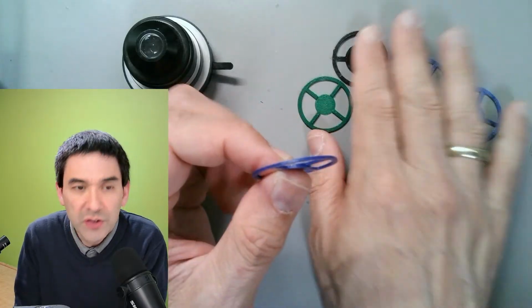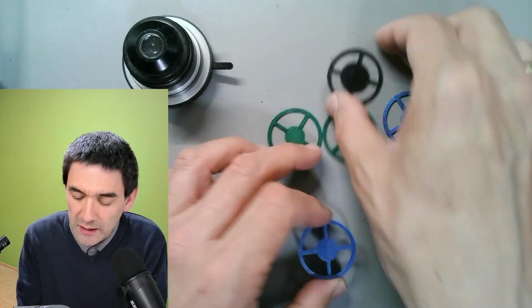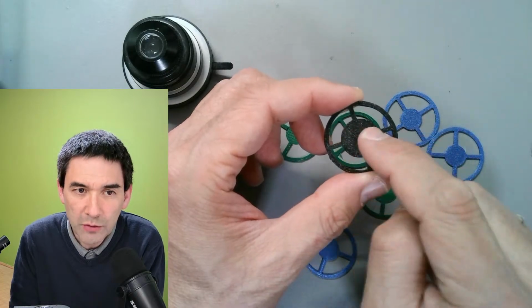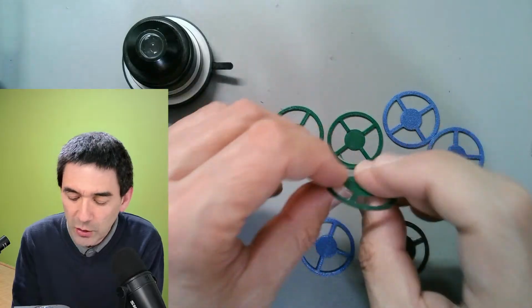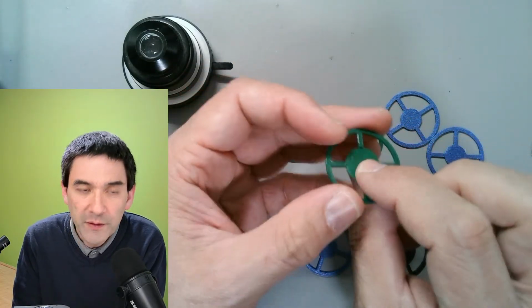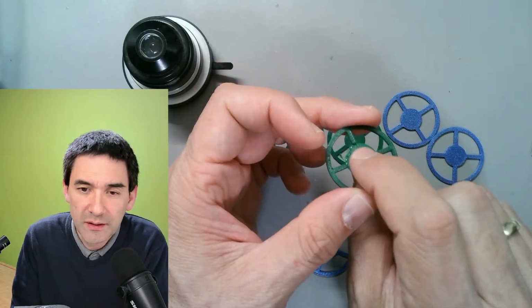What you see over here are different colors, of course, and different diameters. That's basically a so-called dark field filter. Another thing that you don't see so much is that the central patch stop, as it's called, I printed with different thicknesses as well, because the thickness can adjust the color a little bit.